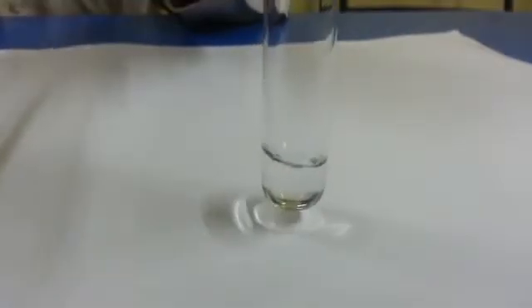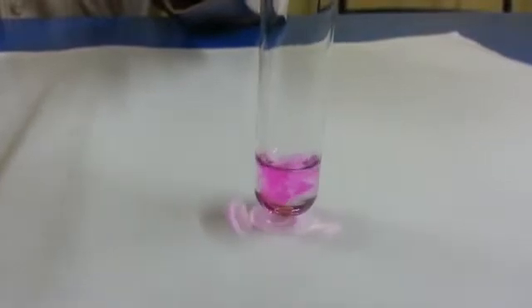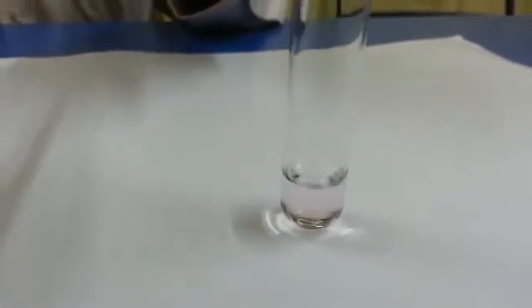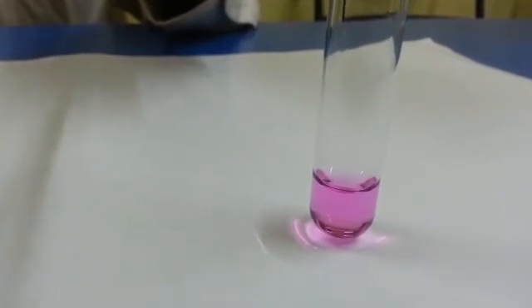You have to be very watchful while adding the last few drops. Now I think this will change permanently. This is a neutralization reaction.